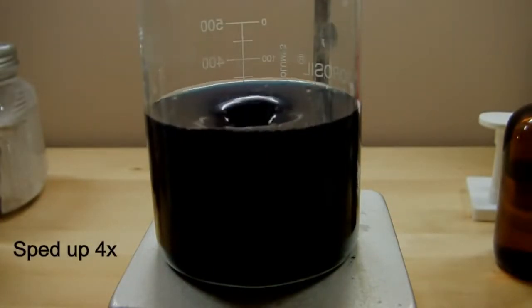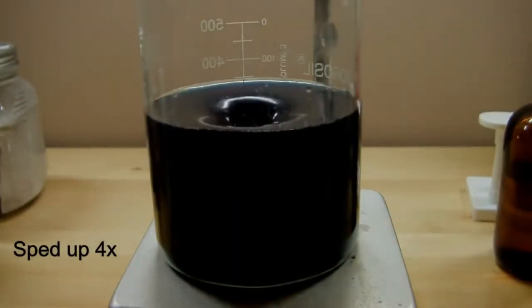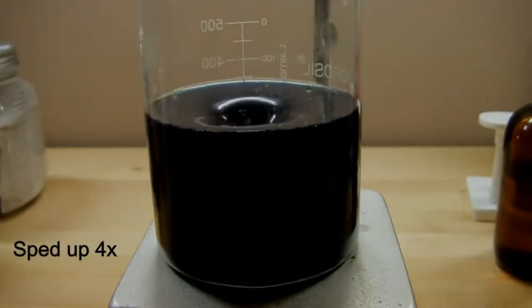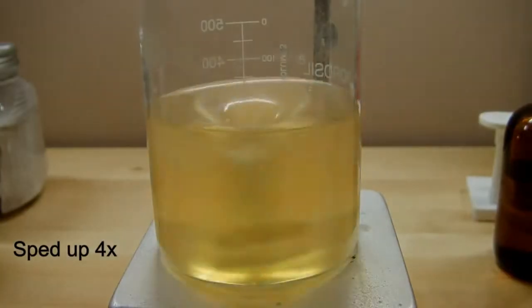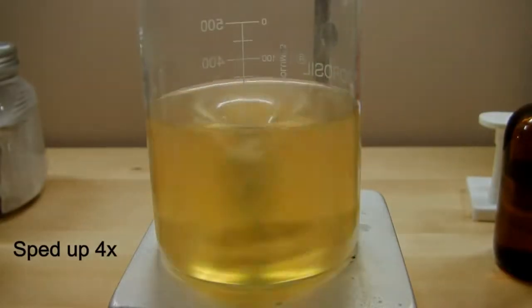So, like I said, the reaction is extremely complex, but I'll try to sum it up for you. So basically, there's 2 separate groups of reactions, a fast radical process and a slow non-radical process. Both of these processes reduce iodate to hypoiodous acid, HOI, with the radical process doing so at a much faster rate than the non-radical process. This hypoiodous acid participates in other reactions that transform it to the iodide ion, I-, and free elemental iodine, I2. The amber color is caused by this free iodine in solution.